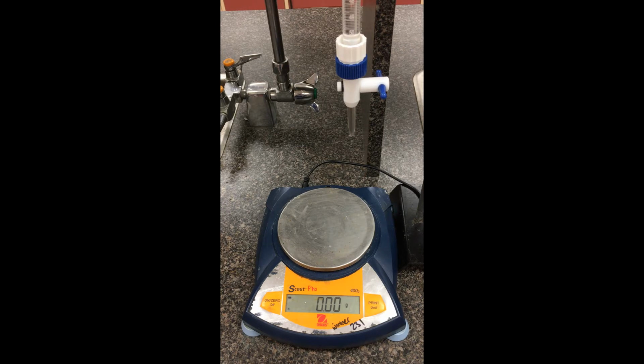Technically, to find density, all you need is one mass and one volume reading, but to hopefully minimize some random errors, we're going to take down many different masses at incremental volumes. We're going to be plotting it graphically with mass on the vertical, volume on the horizontal, and through calculating the slope, hopefully that'll give us some nice average of the density for these solutions.